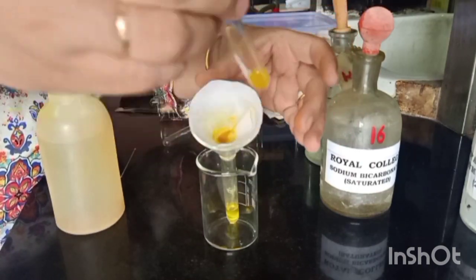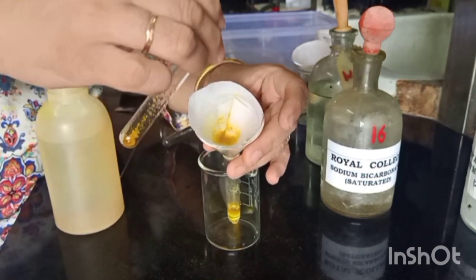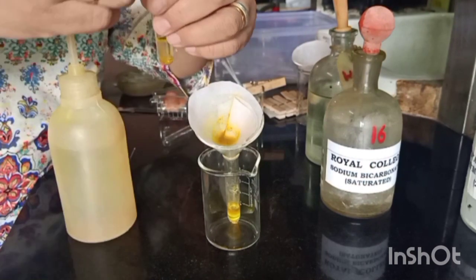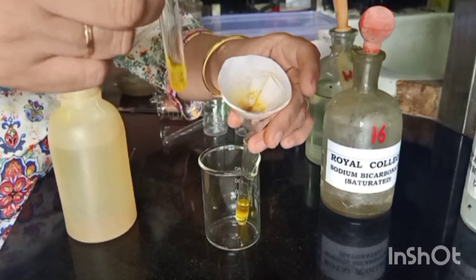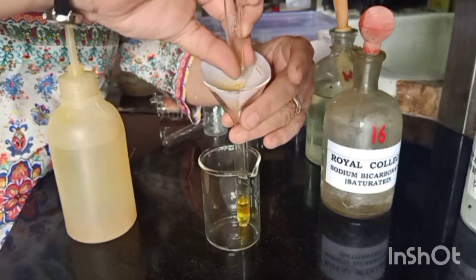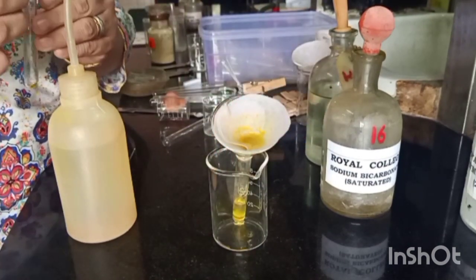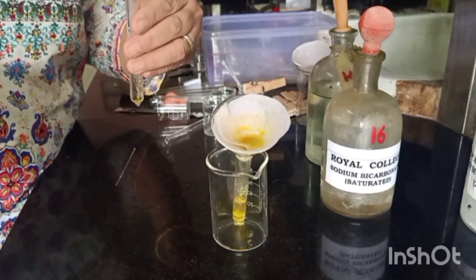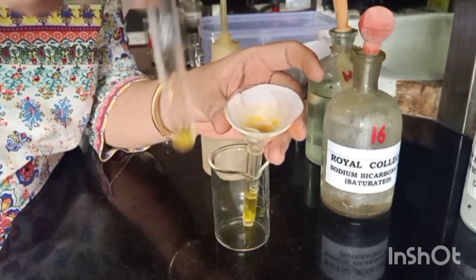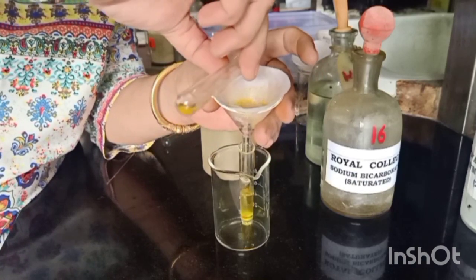It will also help in transferring this residue. The water will ensure removal of any bicarbonate that may have remained. This last washing will ensure the transference of the entire residue and removal of any traces of bicarbonate which may be there.